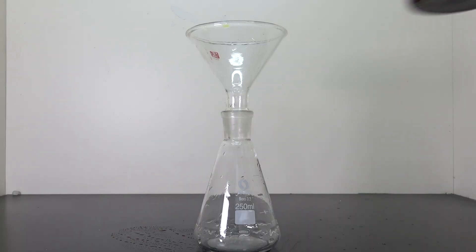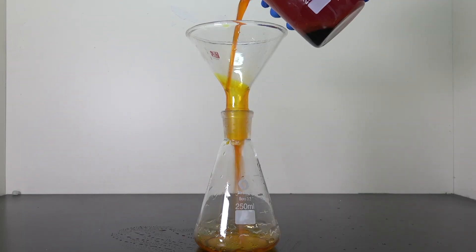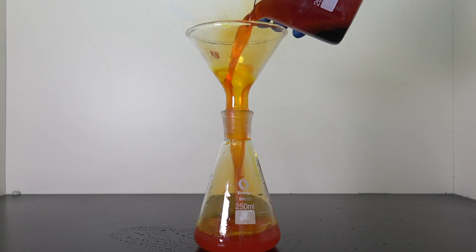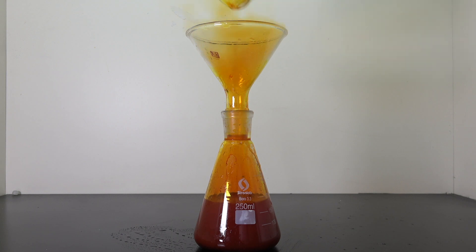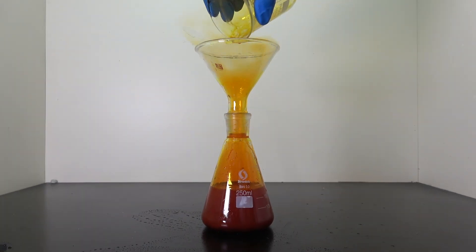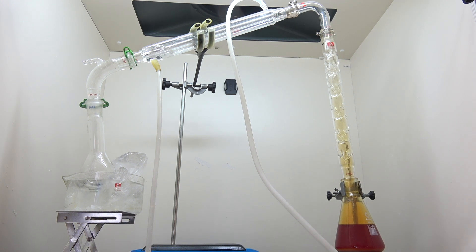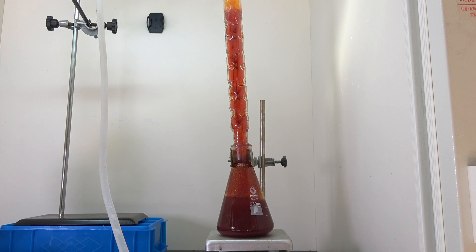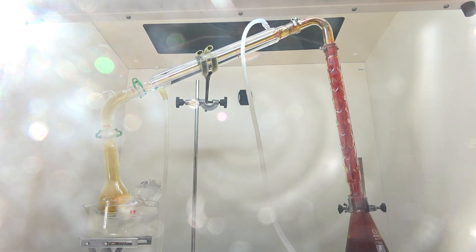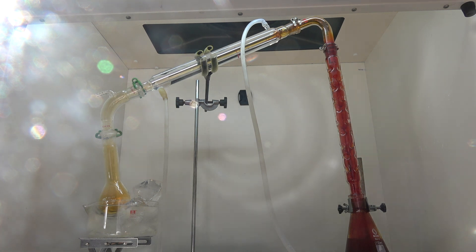Then I transferred everything from the bromine beaker to a 250 ml Erlenmeyer flask. It fumed tremendously as I was pouring it. This is why it must be done in a fume hood or in a well-ventilated area. Then I set up for a fractional distillation. This will serve to remove any water, fragments from the electrodes and the salt bridge, as well as unreacted sodium bromide.